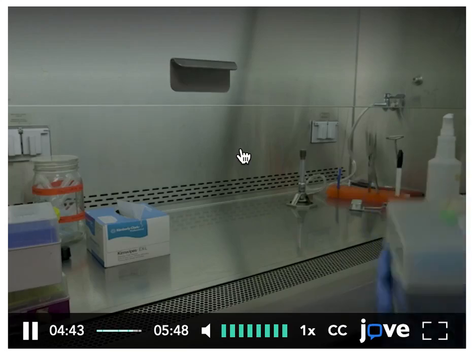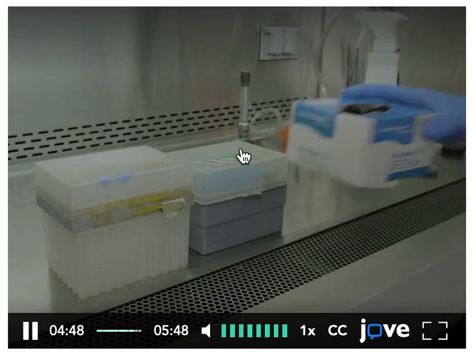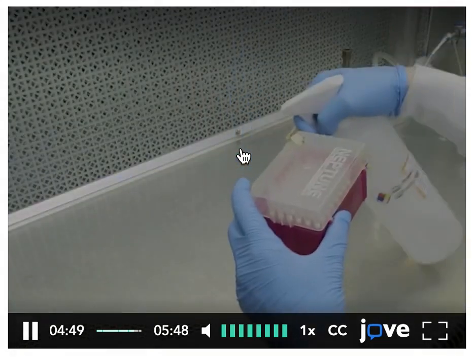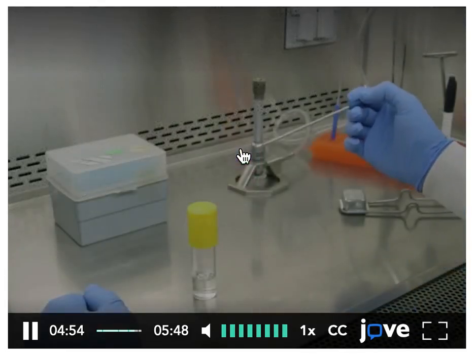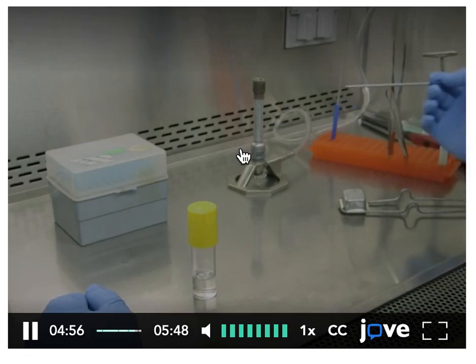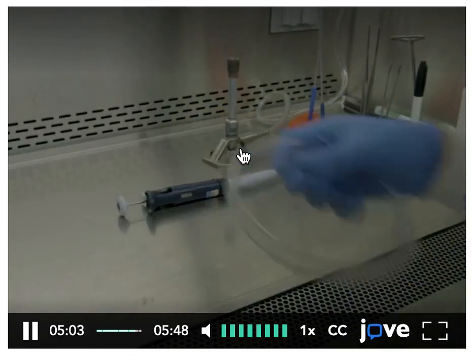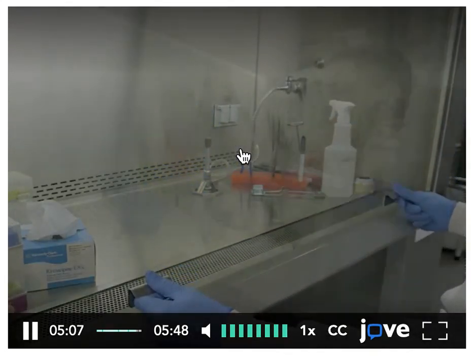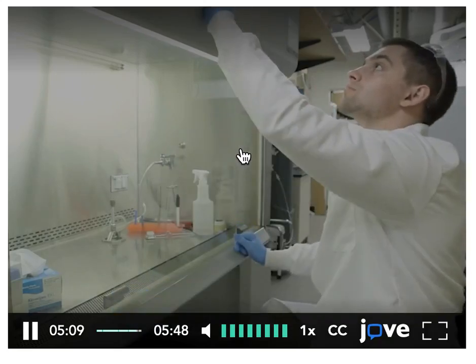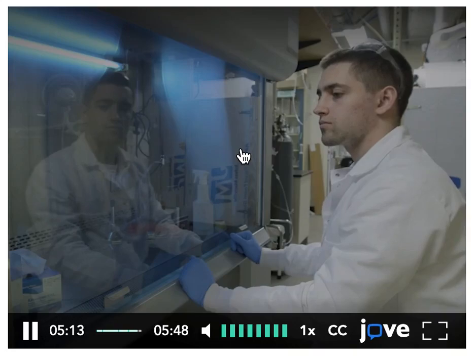Keep the cabinet free from clutter and make sure objects are placed at least 6 inches from the edge, as that is the area most likely to be contaminated by laboratory air. Also, do not place items in danger of cross-contamination downstream from each other. When you are done, remove all items from the workspace to prevent clutter and close the sash to prevent contamination. Then, if the cabinet is equipped with a UVC light, turn it on to disinfect the workspace.